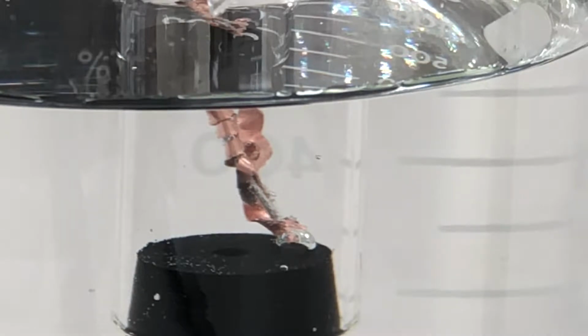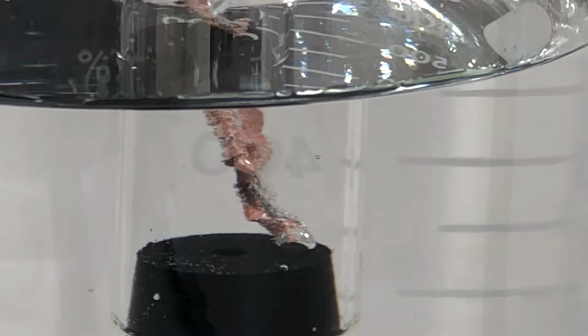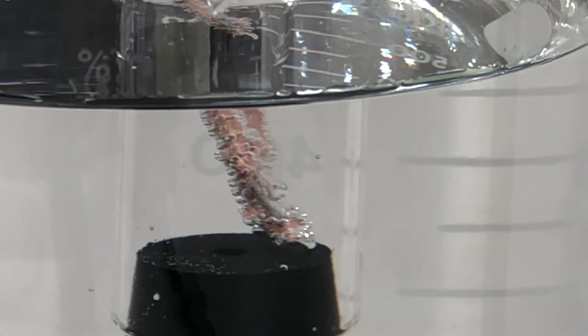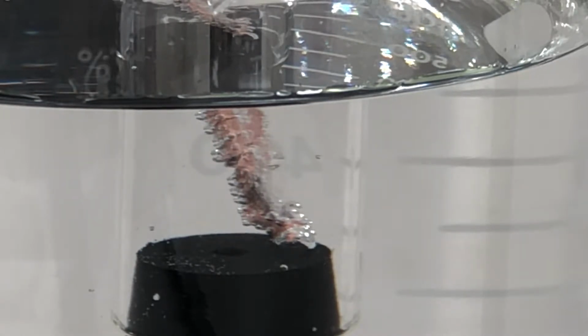So what's happening is the acid is breaking apart, the HCl, and it's reacting with the magnesium metal. The metal, the magnesium, it's in solid form. It is being oxidized, so it's losing electrons. And the magnesium is turning to Mg2+. And so in our product side, the magnesium chloride, it's a chloride, so it's going to be soluble or aqueous. So we have Mg2+ and chloride ions floating around in solution. The hydrogen ions from the HCl are pairing together and forming hydrogen gas.